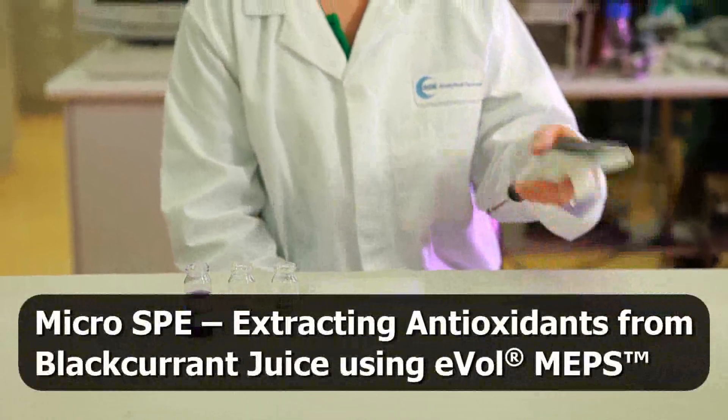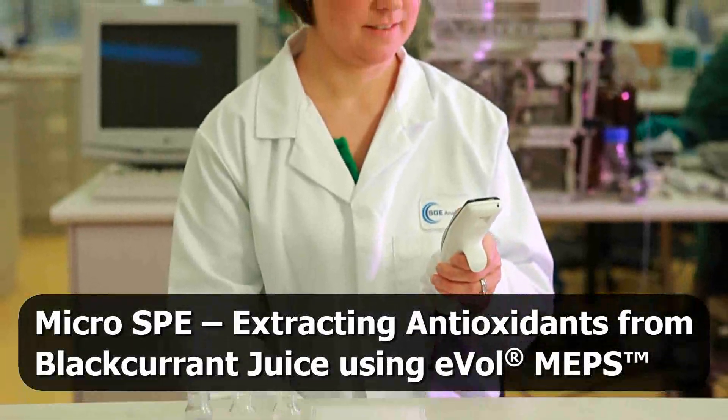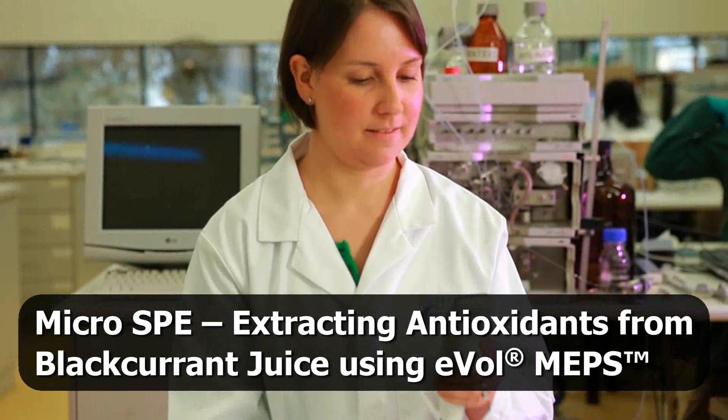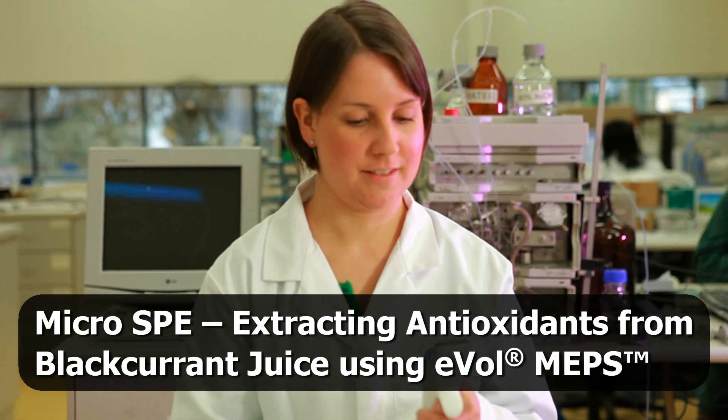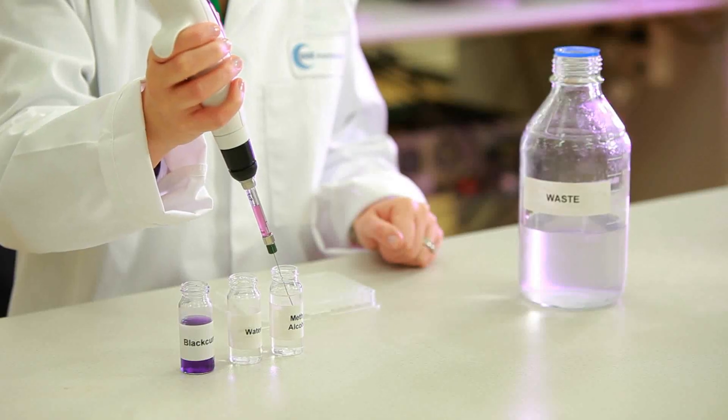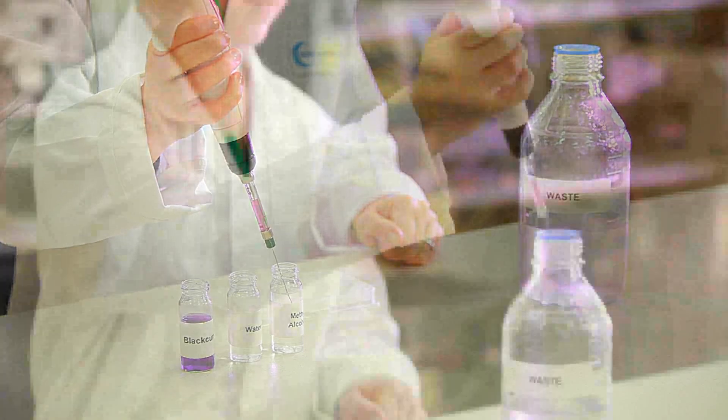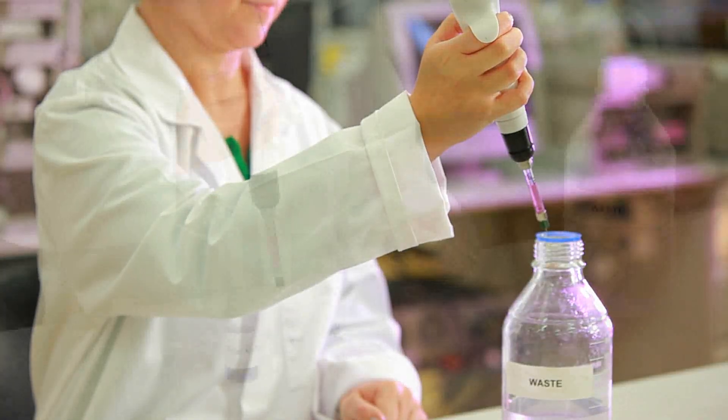EVOL can improve and simplify your workflow. In this example, we demonstrate a very common sample preparation process, solid phase extraction, commonly called SPE. First, the integrated micro-SPE cartridge is conditioned with methanol followed by deionized water.